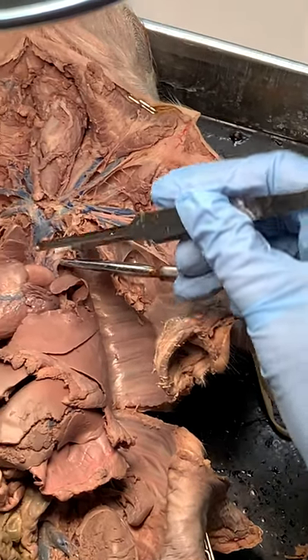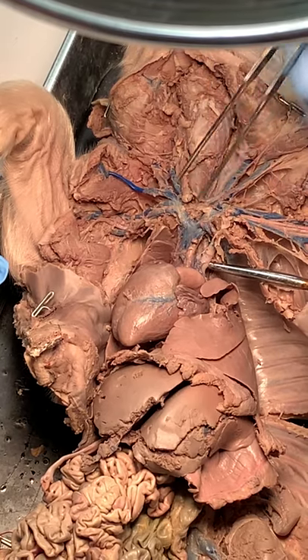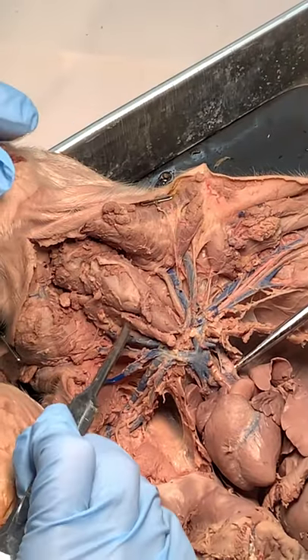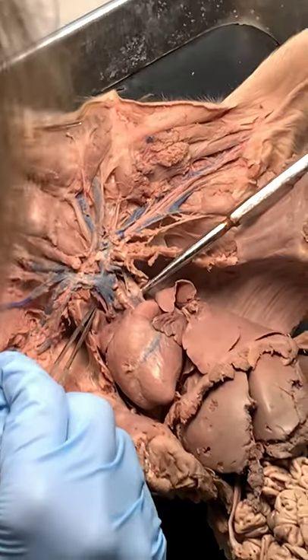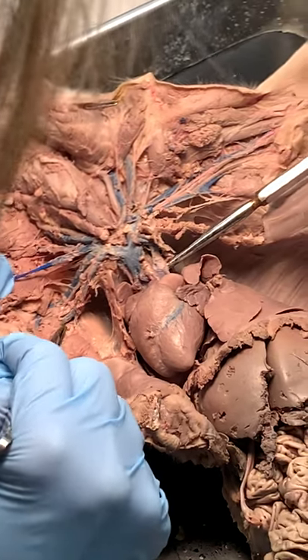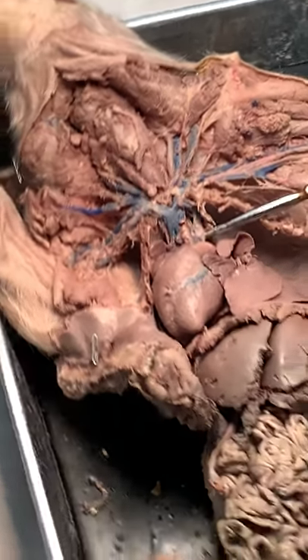This is the brachiocephalic trunk — it's going to go left common carotid, right common carotid, and then to the arm. Right subclavian is a little hard to find here underneath, but let's go to right axillary because I'm in that open space. On the arm, that would be brachial. When we're pinning, look for a vessel that has red or blue in it.